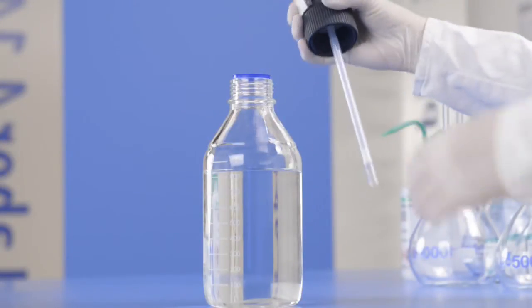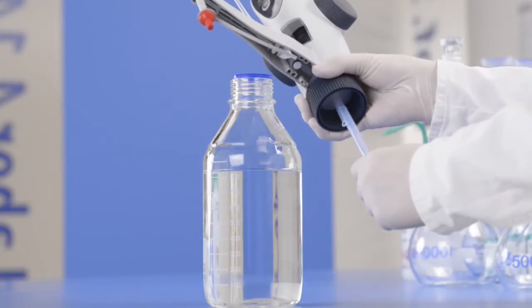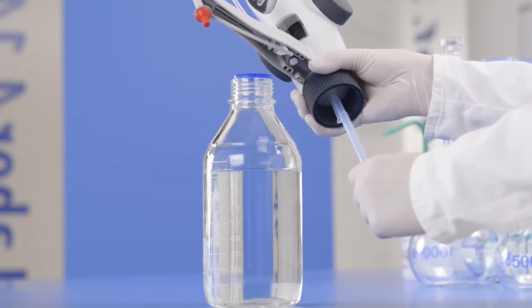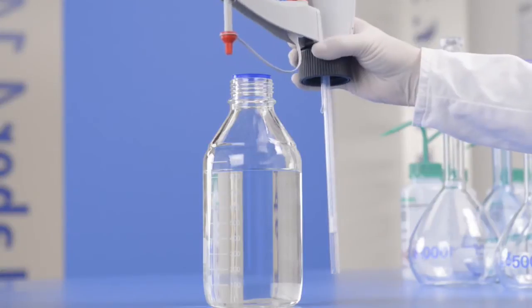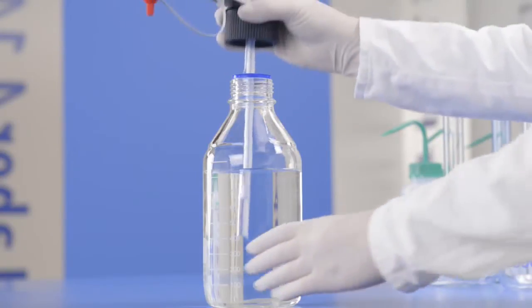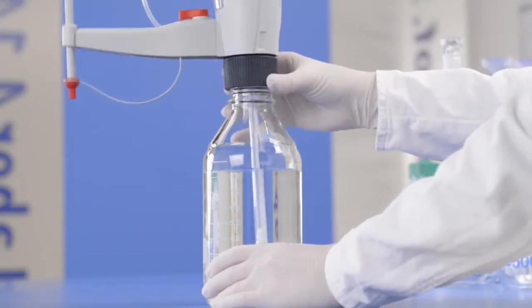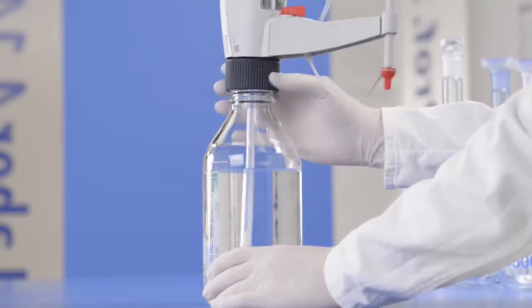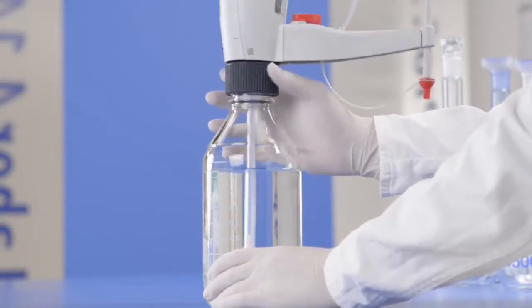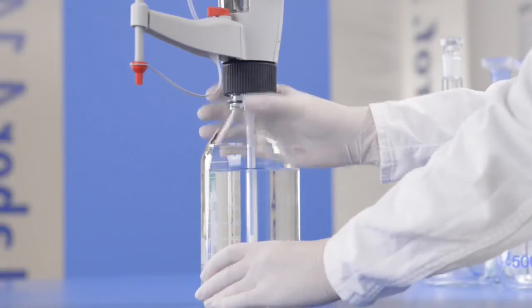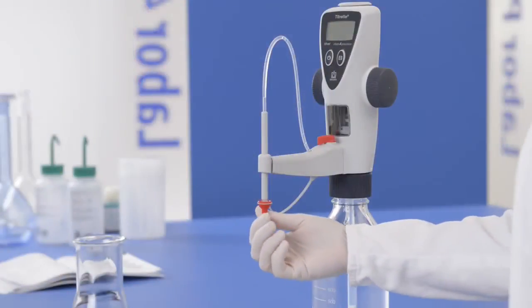Adjust the length of the filling tube by pulling it out or pushing it in until it fits the height of the bottle filled with titrant. After mounting the Titrette onto the titrant bottle, adjust the titrating tube. The titrating tube may still contain residual test liquid.